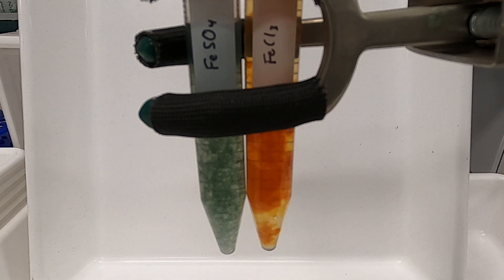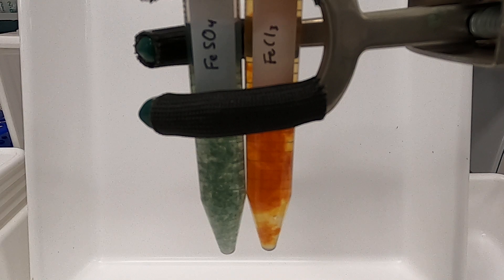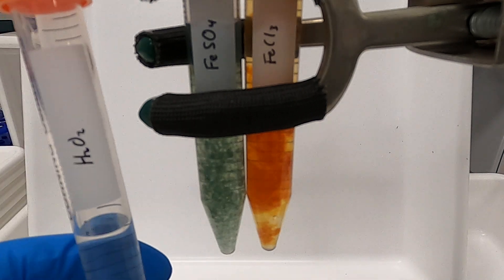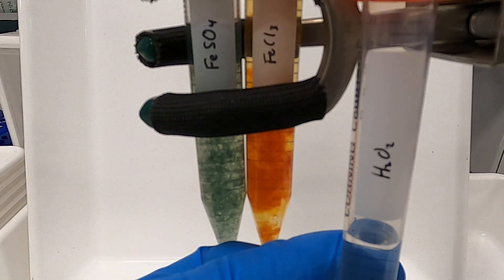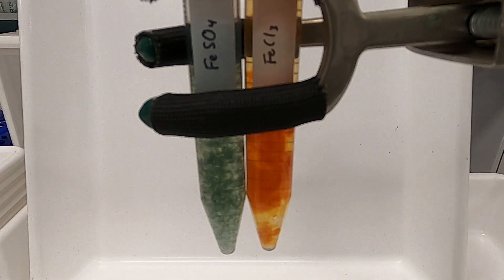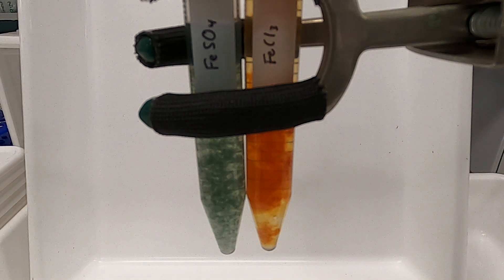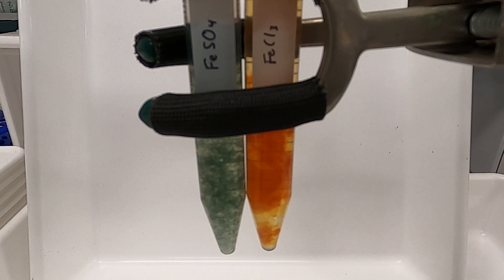What we're going to do now is add some hydrogen peroxide, H2O2, to the tube on the left and watch what happens.